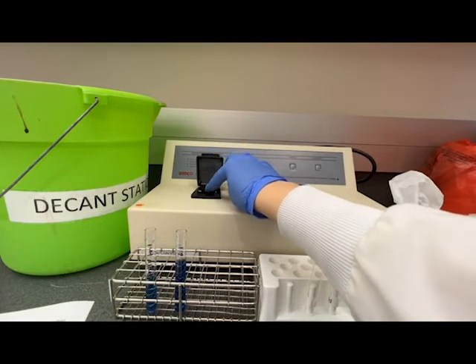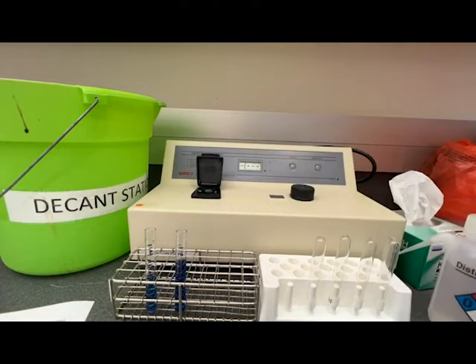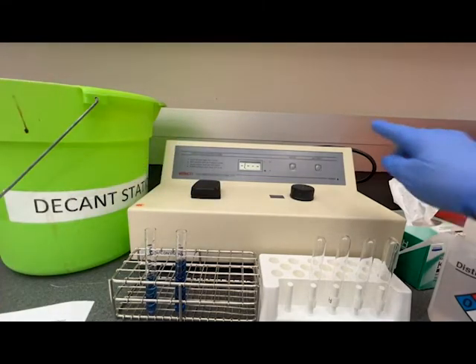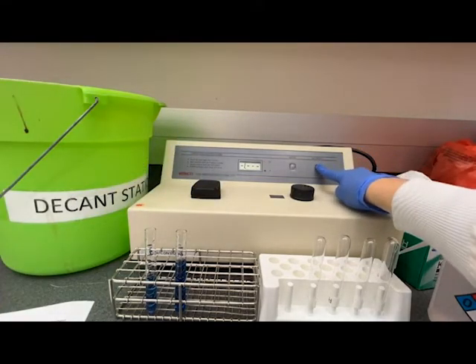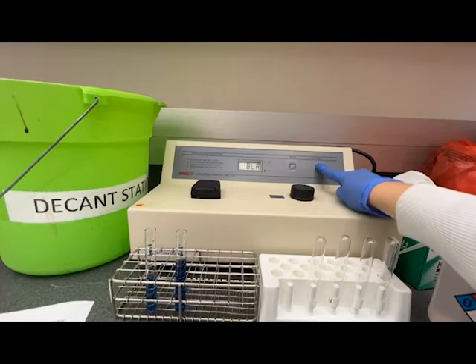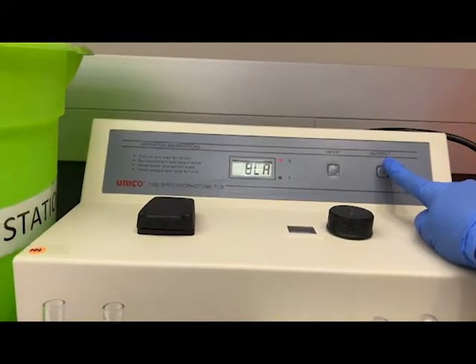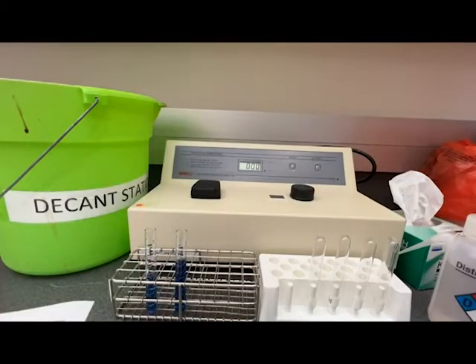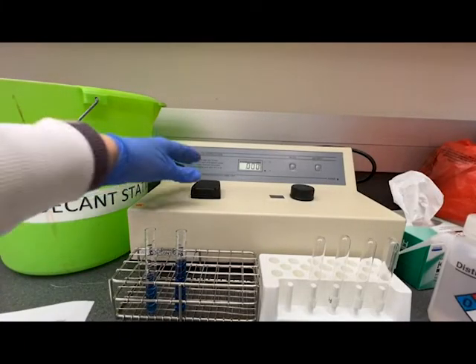Then I lift the chamber door and gently insert it and push it down, and then close the chamber door. At that point I can press the 0 A or 100% T button and that will blank the instrument.